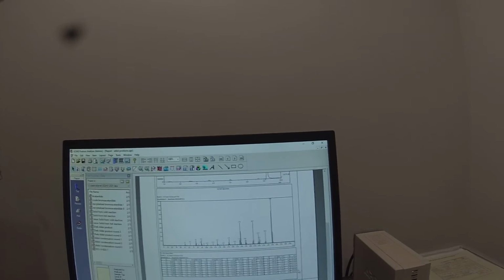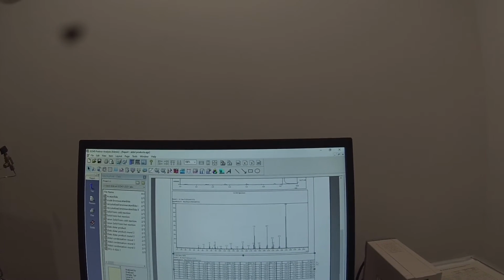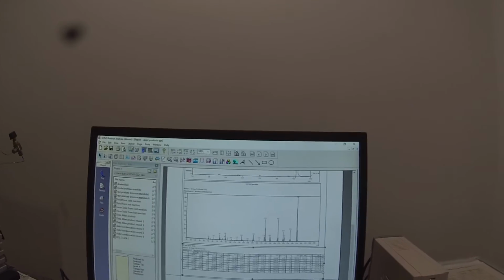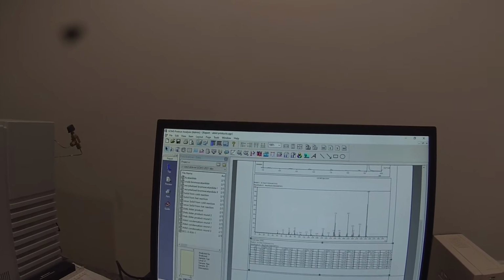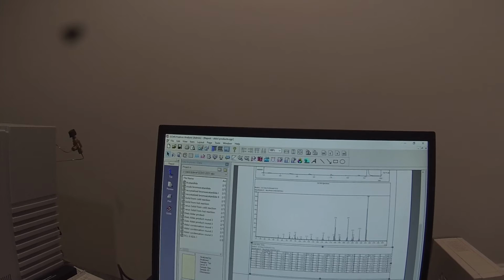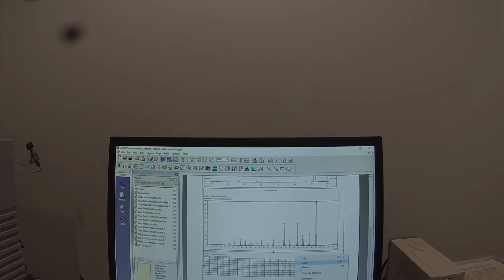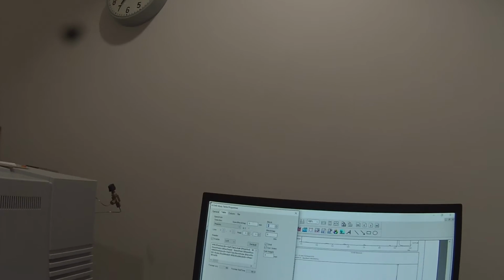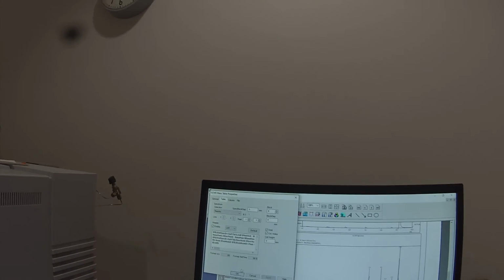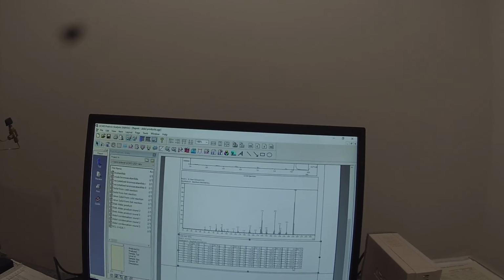And now I see that peak at 250. And if I expand it, we'll be able to see the intensity. That's our base peak at 100%. So I'm seeing my peak number, my mass over Z, my relative intensity. And I actually have got too many columns, so I'm going to go to GCMS table properties and tell it that instead of seeing 7 blocks, I just want to see 6 blocks. That way everything's on scale. I can see everything. Mass over Z, relative intensity. That looks pretty good.